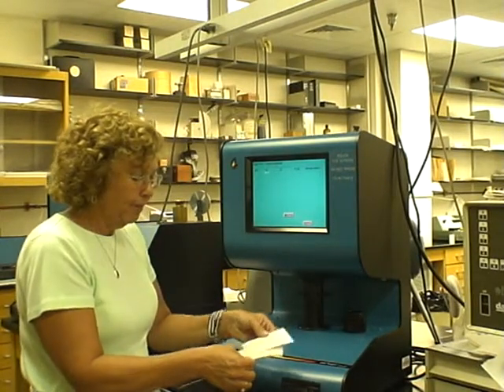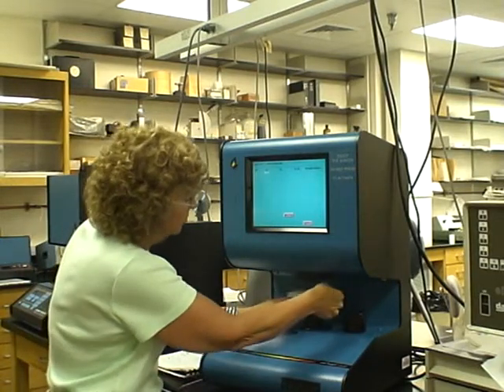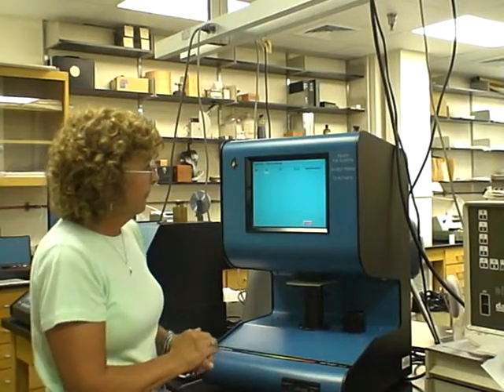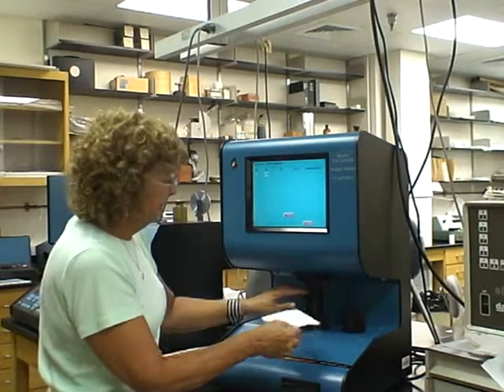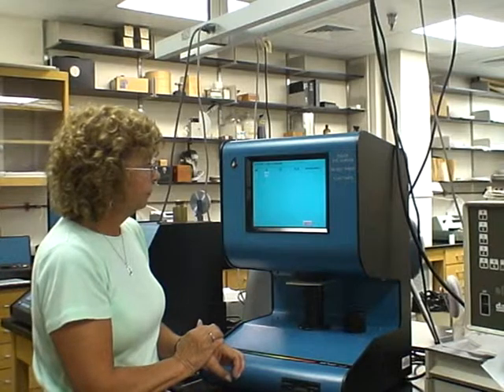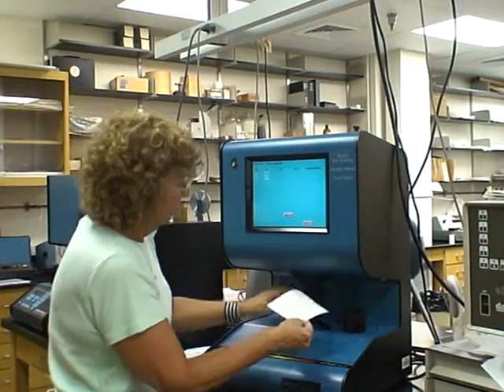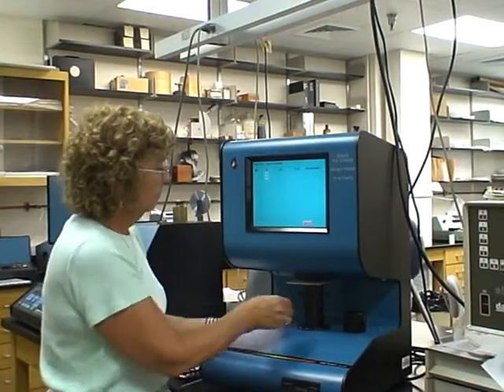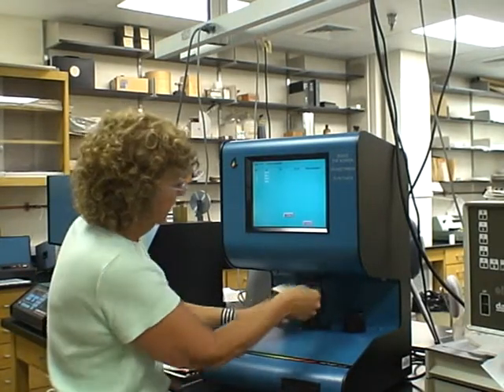Take the top sheet, put it underneath. Make sure you keep your hands from touching all over the pads. Just do it by the edges. Continue taking the top sheet and put it on the bottom and taking another measurement of the pad. And now we're on our last reading.